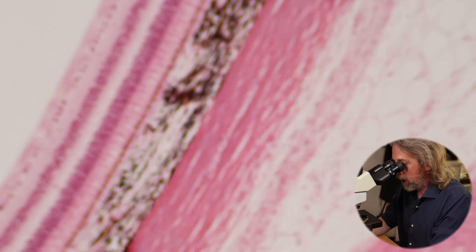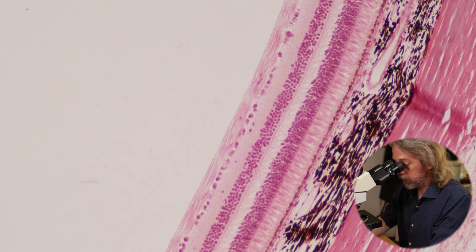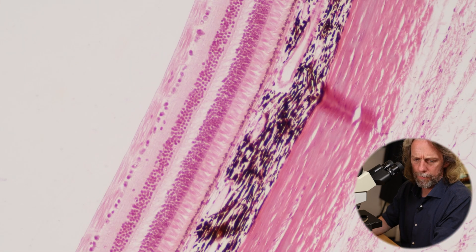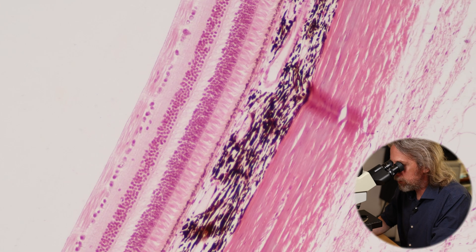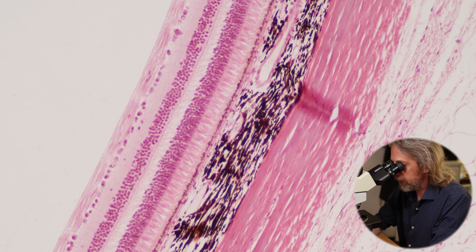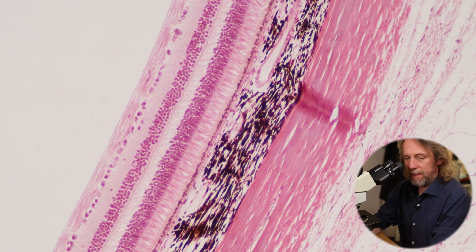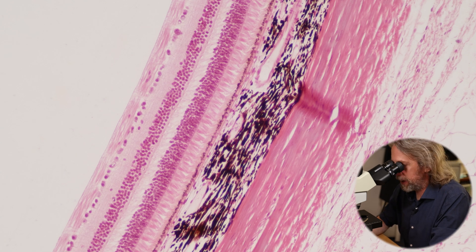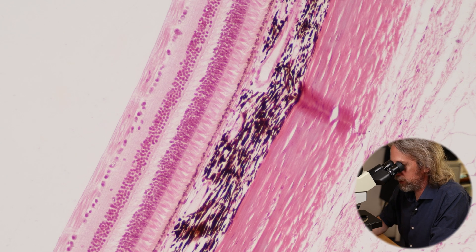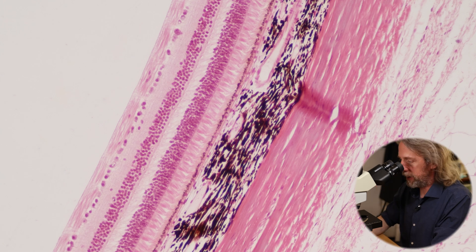So let's jump up. That's with my four times objective lens, 10 times to my eyes, 40 times magnification for me. This is now a hundred times magnification to my eye - it will depend a little bit on the size of your screen. Look at that order - isn't that something? We'll work our way through the layers.